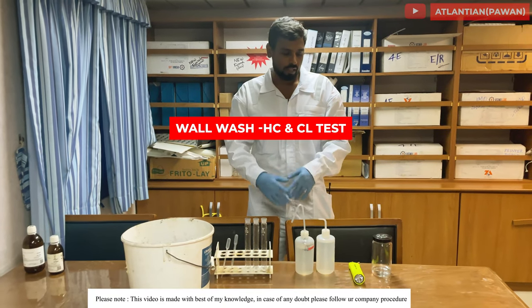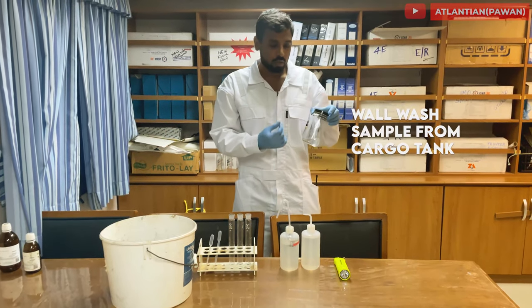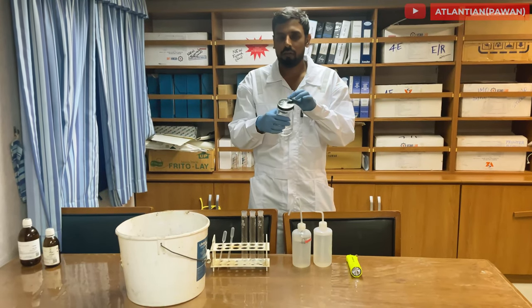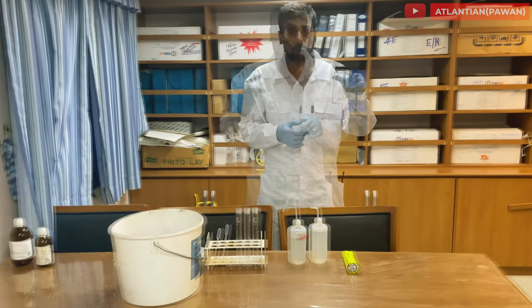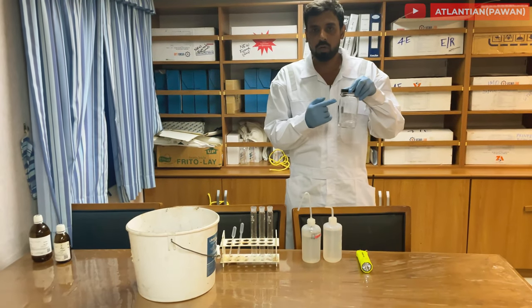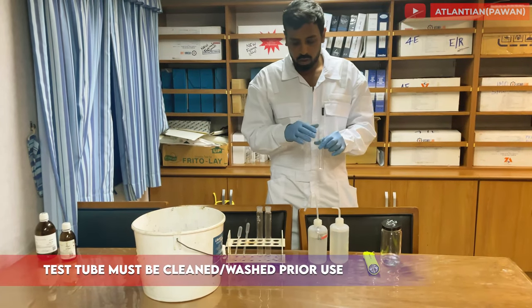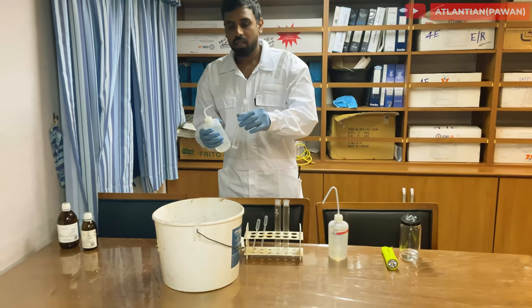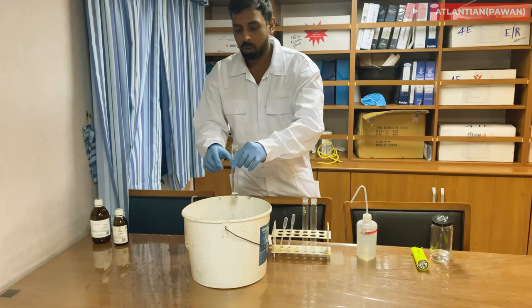Hello everyone. Today we'll see how to do a hydrocarbon test with methanol. First, you have to bring a wall wash sample from your tank — this is my wall wash sample with the tank name written on it. At least 50 to 100 ml is required. Make sure all tubes you are using are already washed with methanol and are clear — the tube itself should not be contaminated. Rinse it properly with methanol.